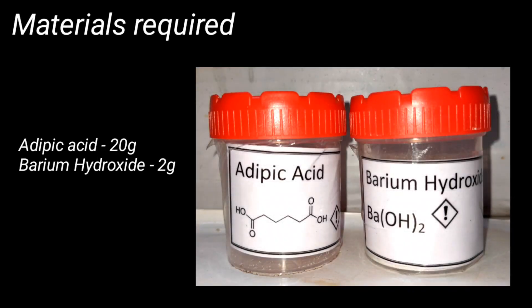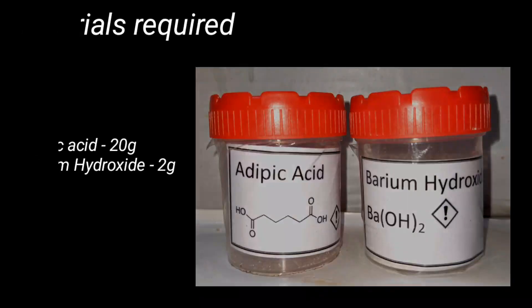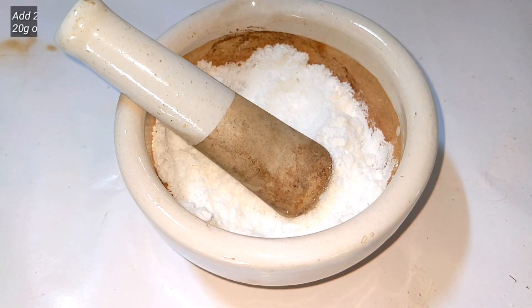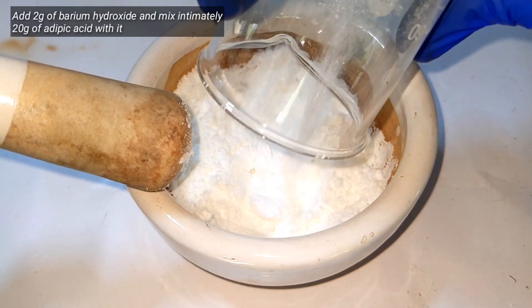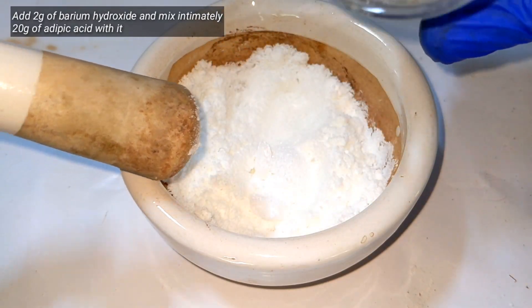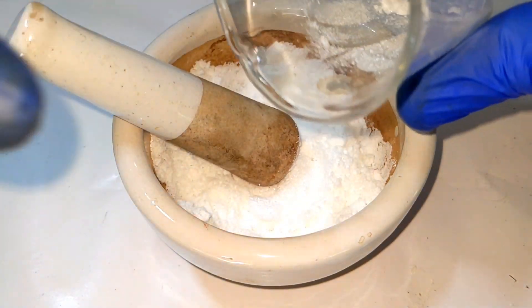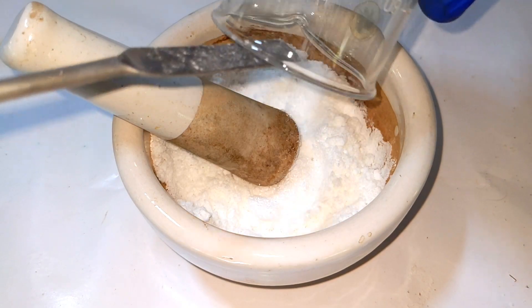Materials required for this preparation include 20 grams of adipic acid and 2 grams of barium hydroxide. Start by mixing both together — they should mix well.